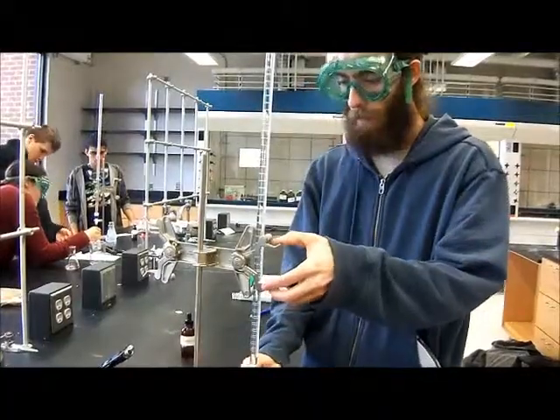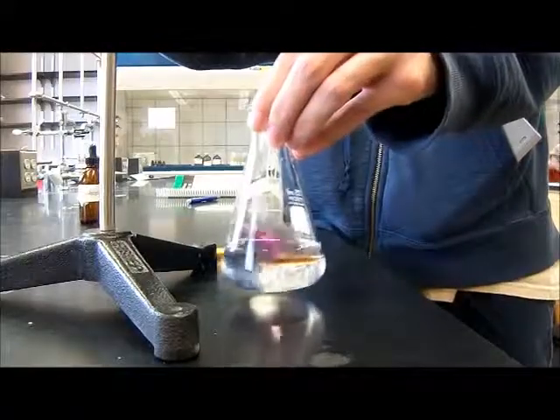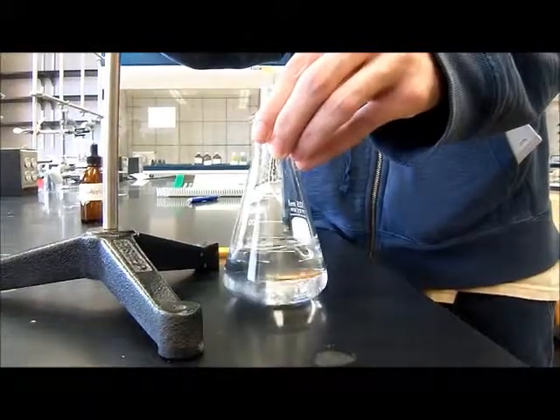So Zach's going to record the initial volume. 0.0. Now Zach is going to start the titration. Getting very close.